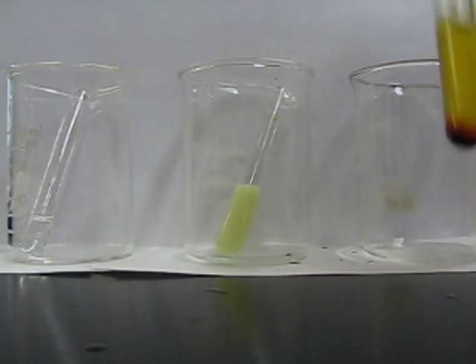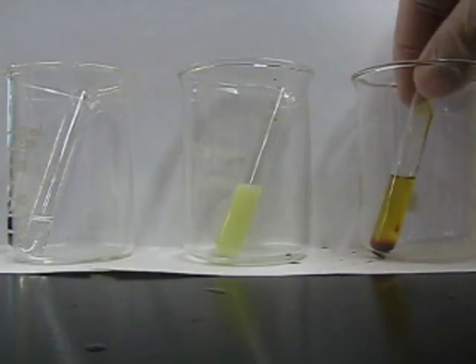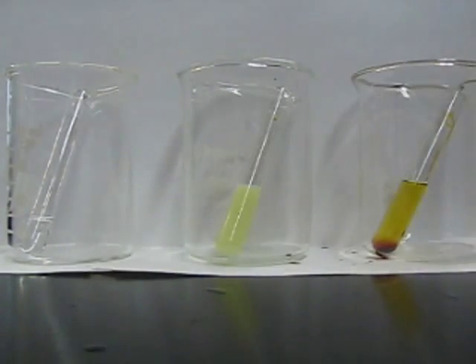If you're not sure at first, you can let it sit over time. The one that's not very transparent, you'll see precipitate form in the bottom. The other one will clear up in its color.